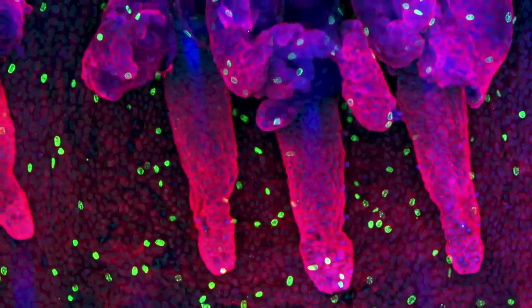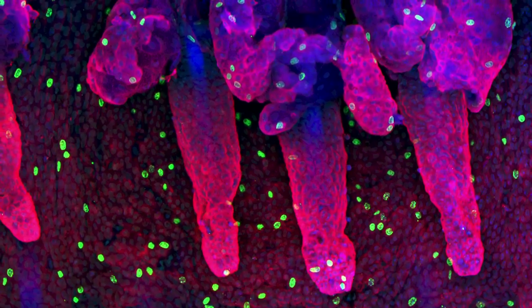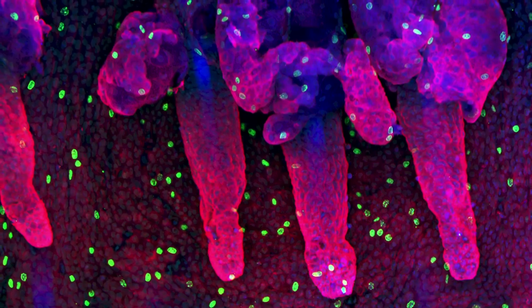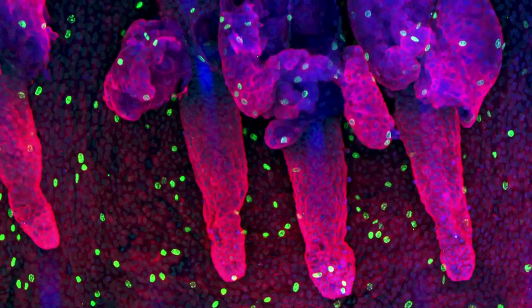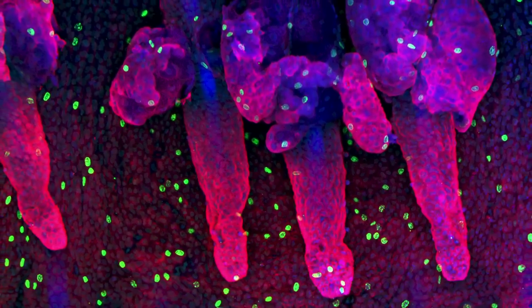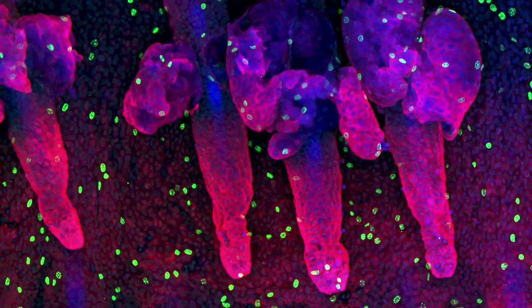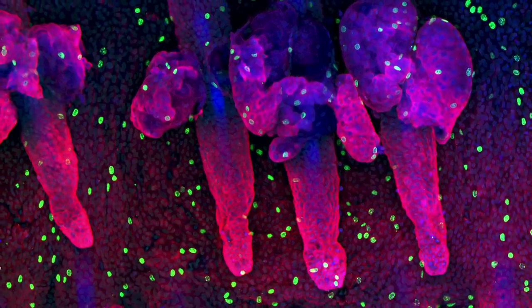Each cell that is stained green is in the process of dividing to produce new cells to replace those that are lost from the surface. Despite skin's rather boring reputation, I think this image shows its complexity and exquisite nature.